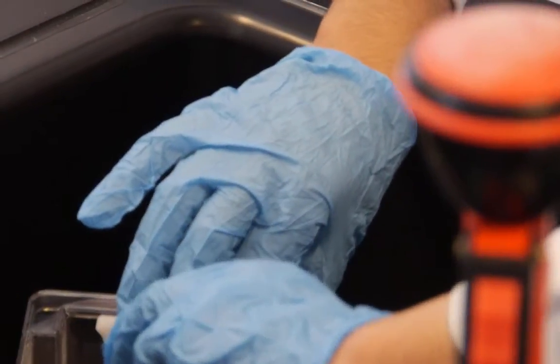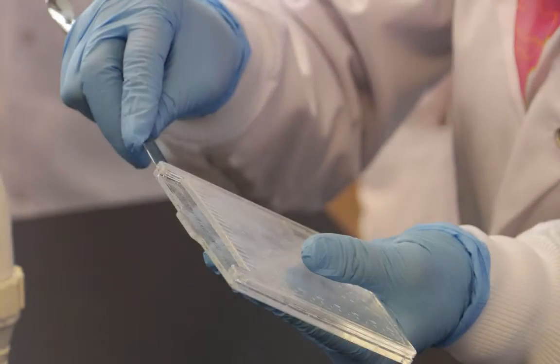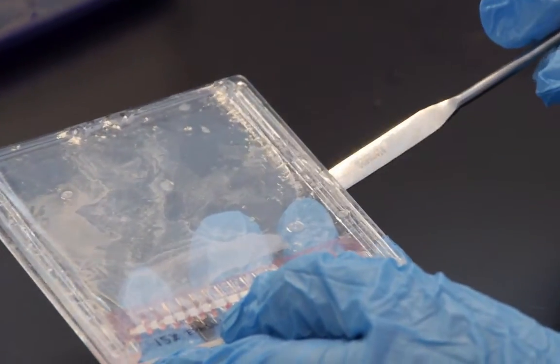After running, the gels were carefully removed from the tank and using a spatula the plates were prized apart. This was carried out by inserting the spatula on the side and twisting.